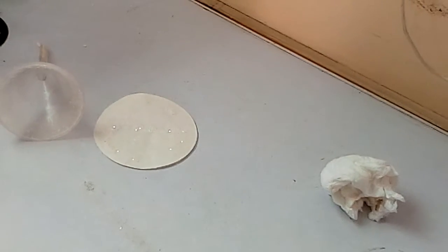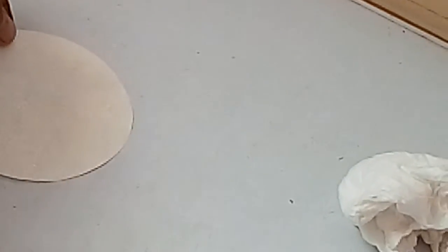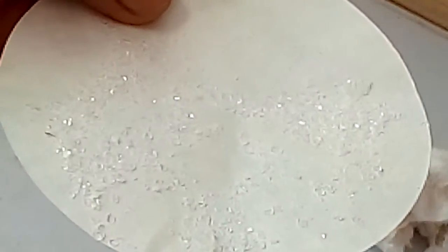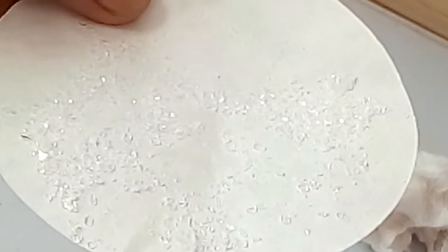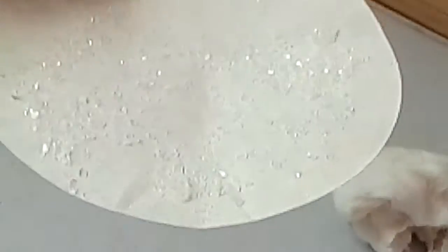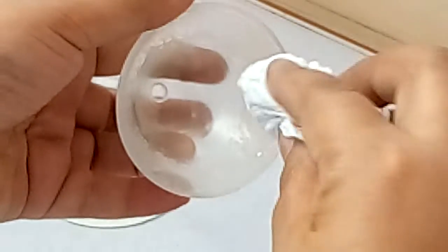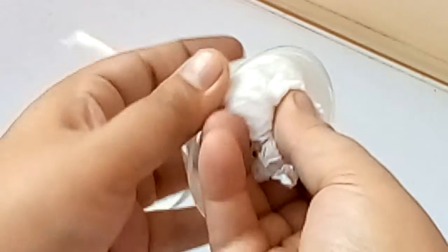Let's have a close-up of the crystals. You can see a lot of crystals found on the filter paper — a lot of crystals are stuck on the filter paper. Not only on the filter paper, but also on the inner side of the funnel, as you can see.